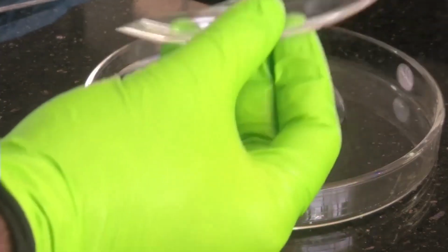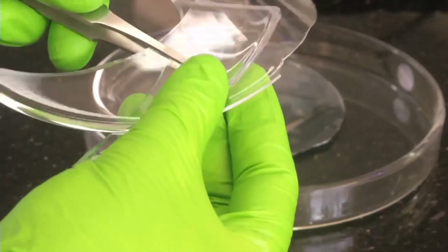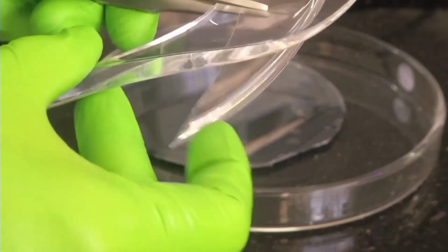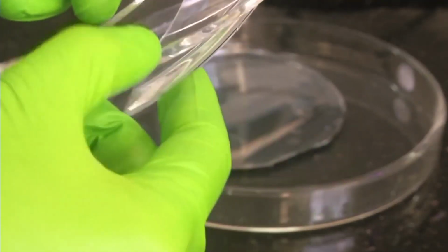See how flexible it is. So preferably you should hold it either with gloves or tweezers. Please never hold it with your bare hands. So this is how the PDMS will look like. It's flexible and fully transparent. See the thickness. This is how thick it will be, and it will be flexible.